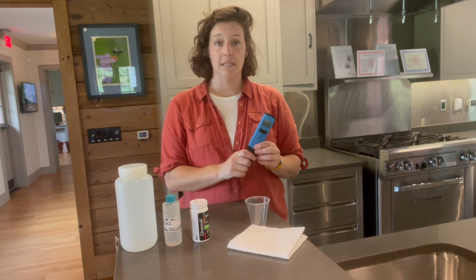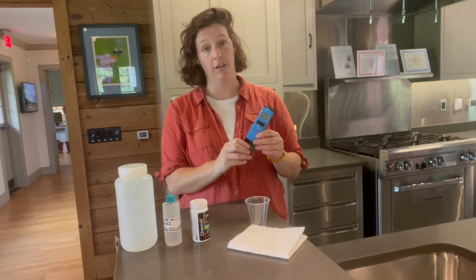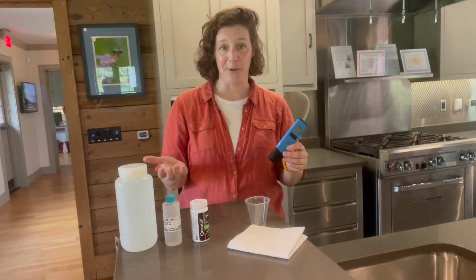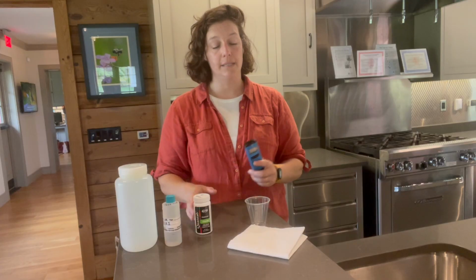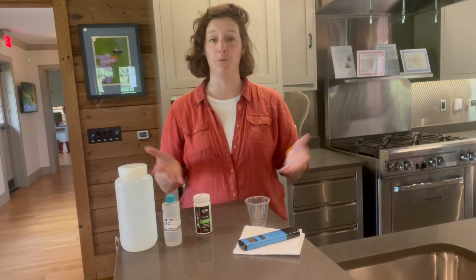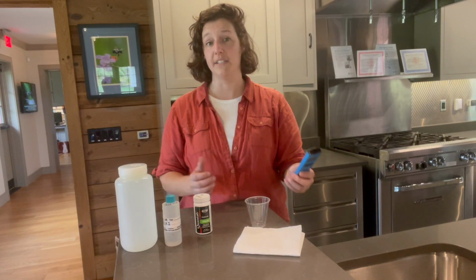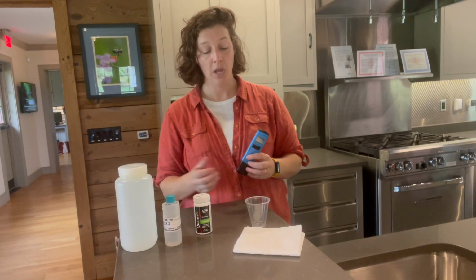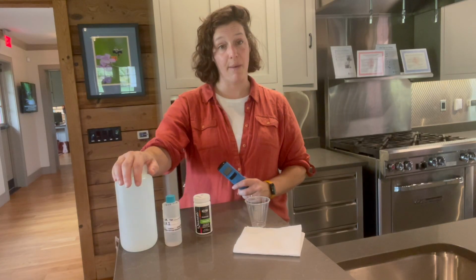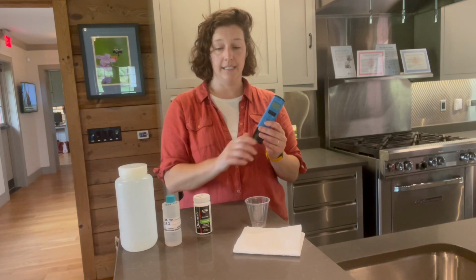So we always like to pair conductivity measurements, which are used as an indicator of human activity and influence on our waterways, with chloride. And chloride is present in our waterways primarily through the introduction of road salt ahead of winter storms. So conductivity levels in the region of southeastern Pennsylvania tend to be very closely linked with salt levels. So today we're going to examine our samples from Okahocking Run at Rushton Woods Preserve for conductivity and chloride.